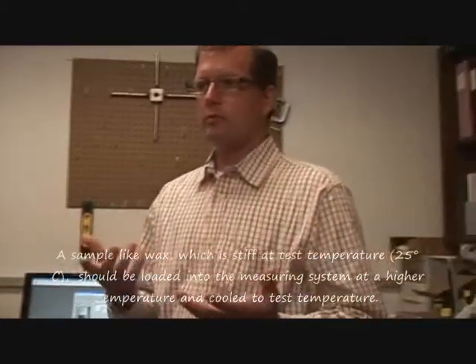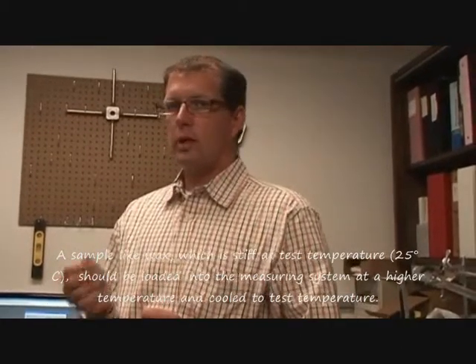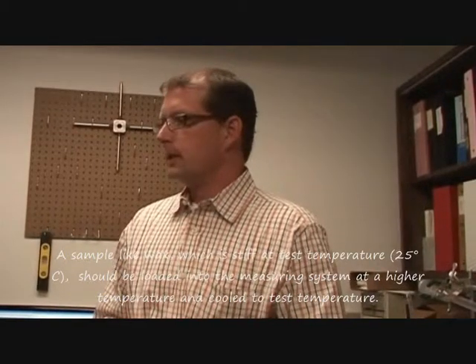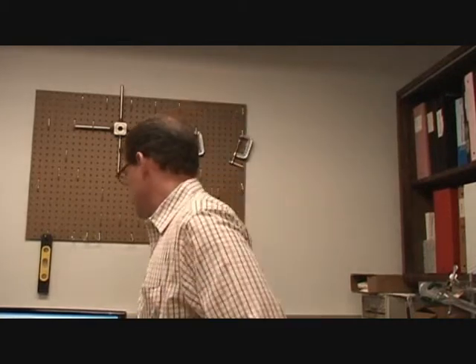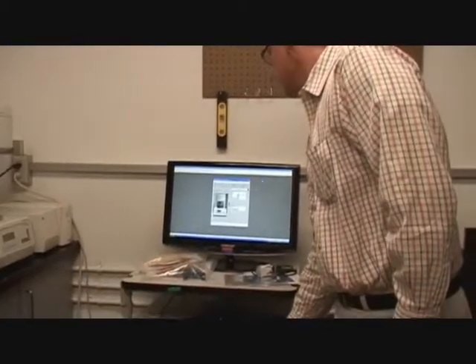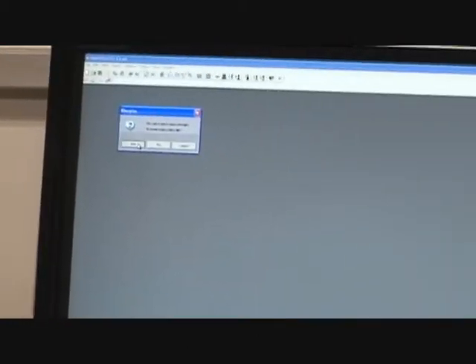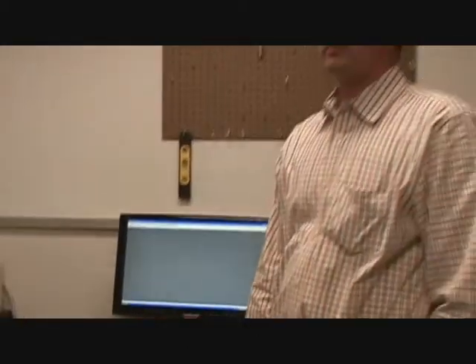So I think what we'll do is we'll load it at a higher temperature, trim it and everything, and then we'll run it back down to 25 and let it go. A couple of things we need to do first: if we're going to run at 25 degrees, we need to set our gap at 25 degrees. So first thing I might want to do is save all my changes. If I'm going to run this sample, I want to run an amplitude sweep — how do I get started?